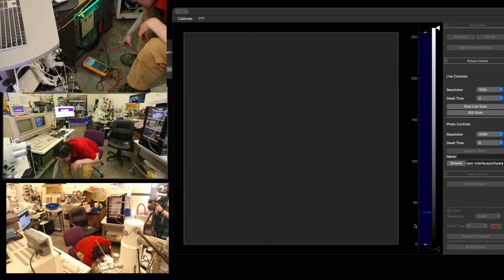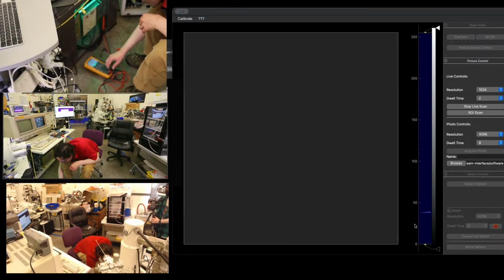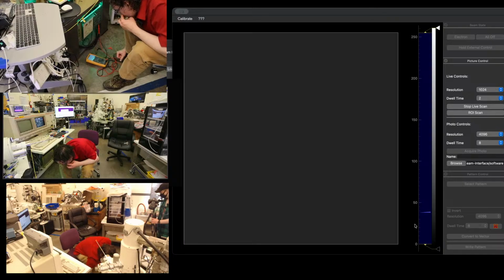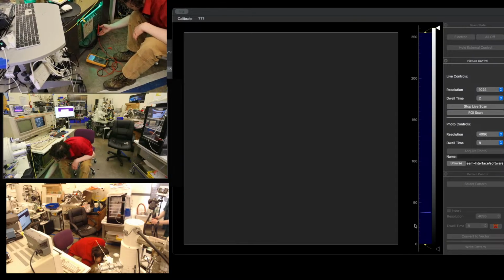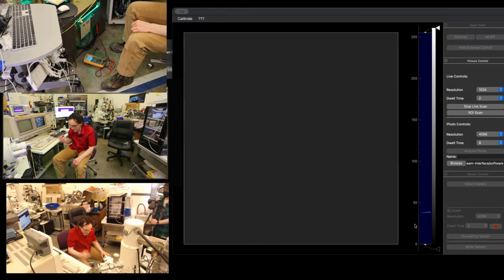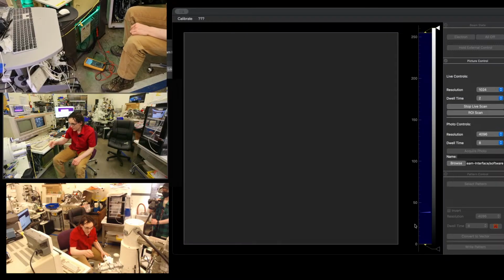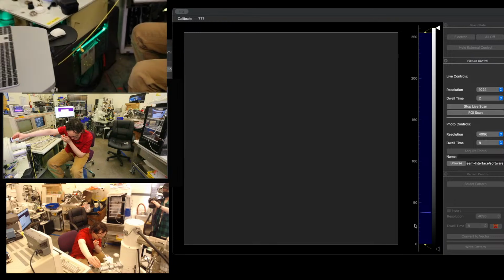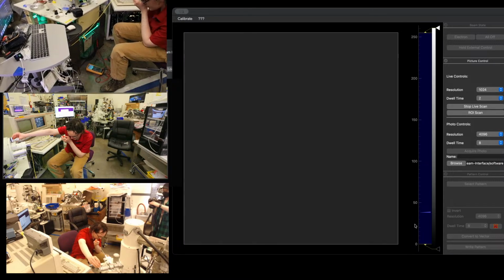PG1 is negative 9.47, so the gauges on this one are not quite correctly calibrated. Let's go ahead and switch to voltage reading, just because we're going to load it less. It's not really how you're supposed to read these test points, but we're going to be doing it that way, because I don't know what's going on quite yet. Okay, so we got 0.191 volts. Let's go ahead and vent our load lock, see if that goes up. 0.191, that's stable.